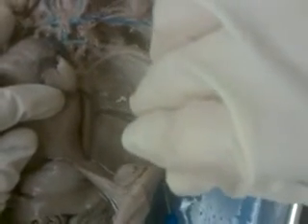Now let's see here if we can get this moved over. Okay, right against the vertebral column. That is the thoracic aorta, and it isn't as well injected in this one as some others. Some other people have more of a picture book example, but this vein right here, that's called the hemiazygous vein, okay? And it's draining primarily from the left side of the back and the area between the ribs as well. And then in between the ribs, there are those intercostal arteries and veins, okay? In between. See, they just look like little lines here, little pink lines, okay?